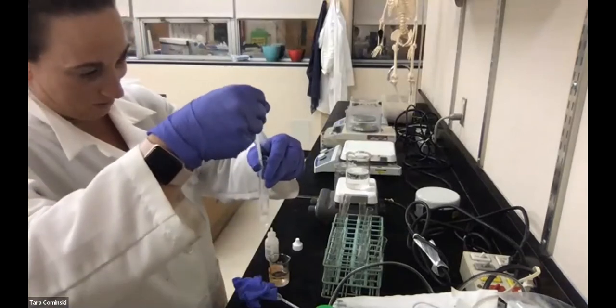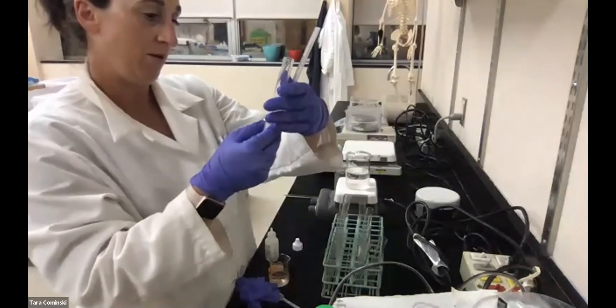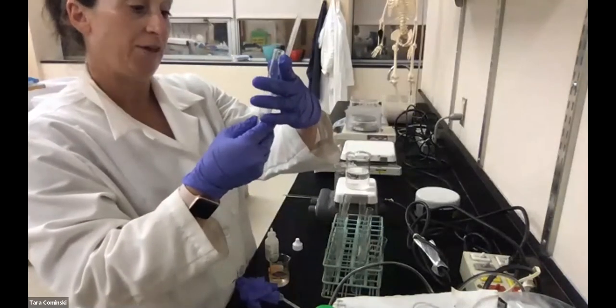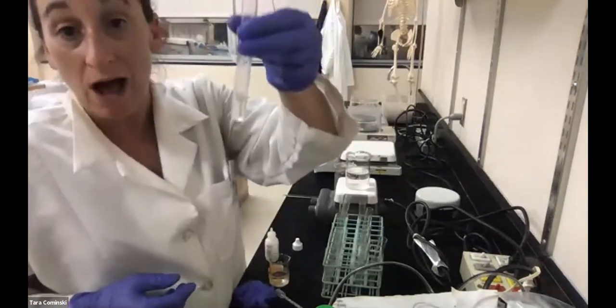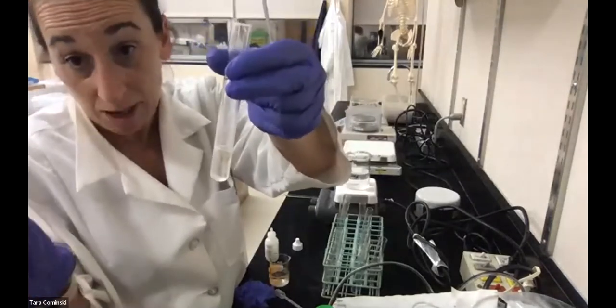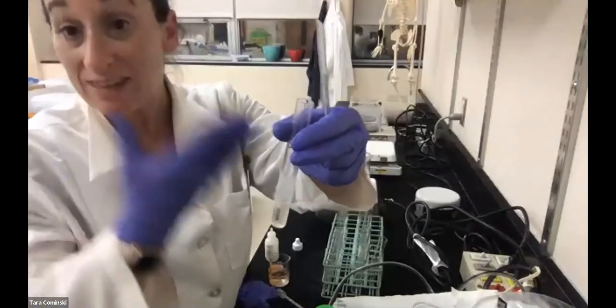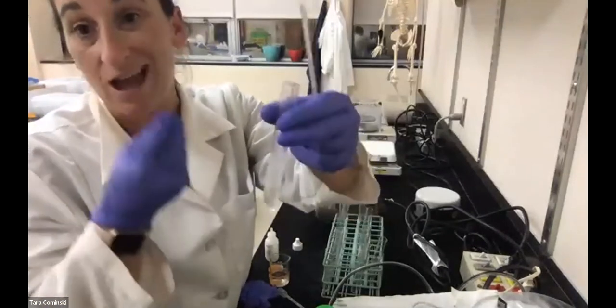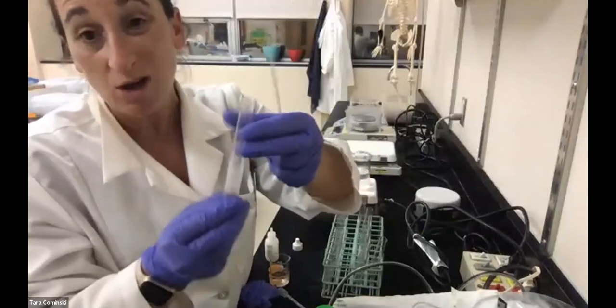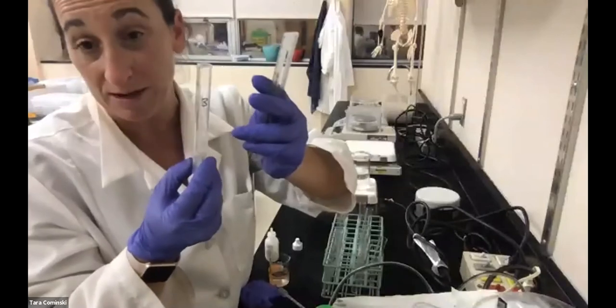All right, so this is pretty easy. It's really nothing. The bubble height here is nothing. You can even see the catalase is clumped up. So that was at 100 degrees Celsius. We had the enzyme in there, we boiled it at 100 degrees Celsius, and we saw there were no bubbles. The bubble column height is 0 millimeters.